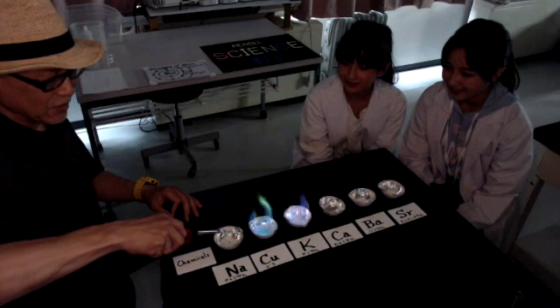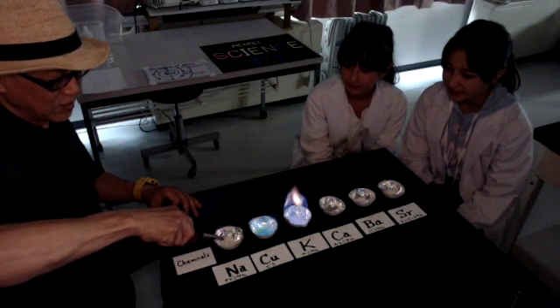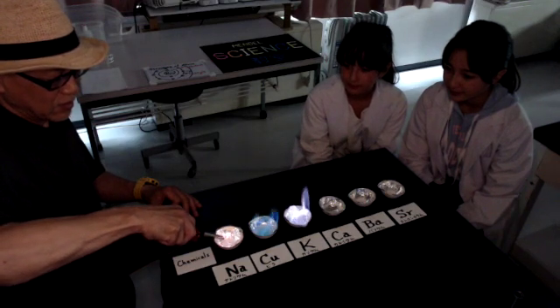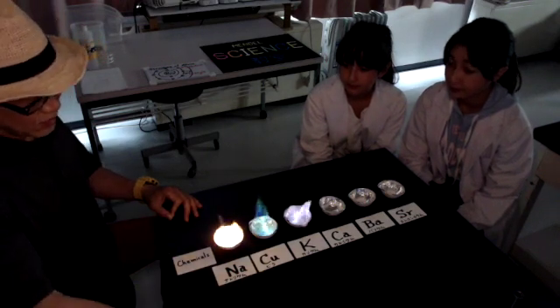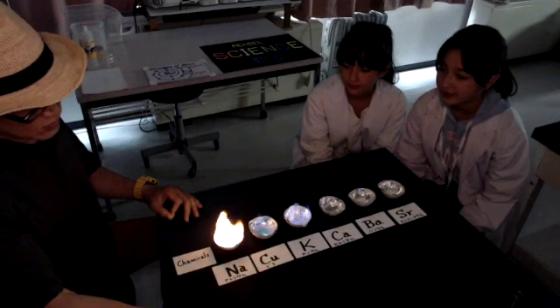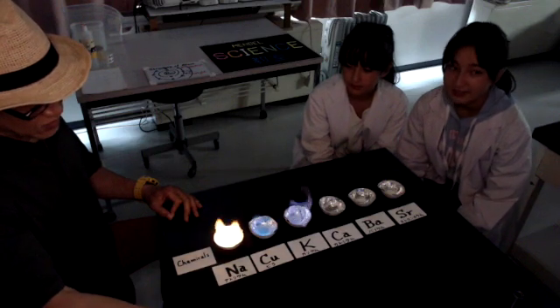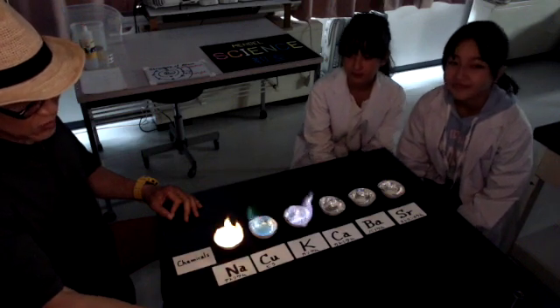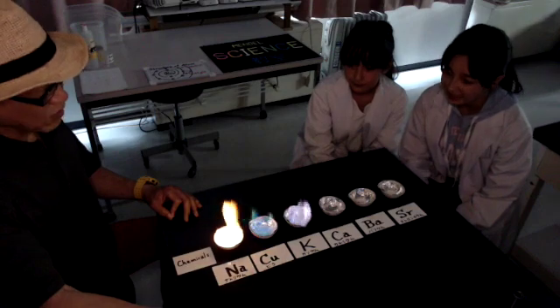And the last experiment is sodium. Sodium releases the orange color light.